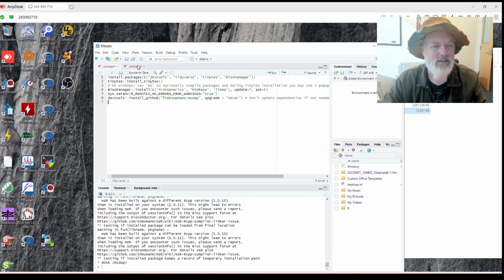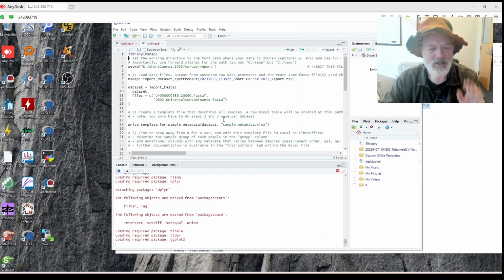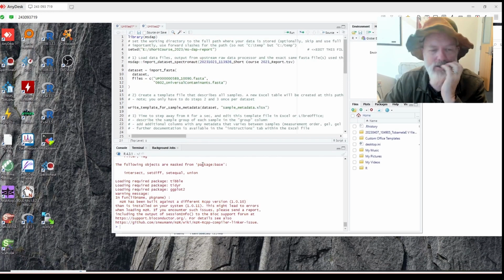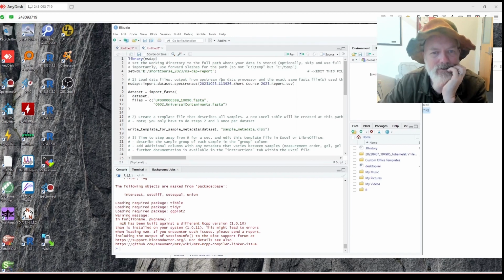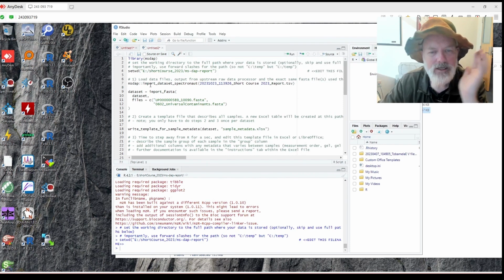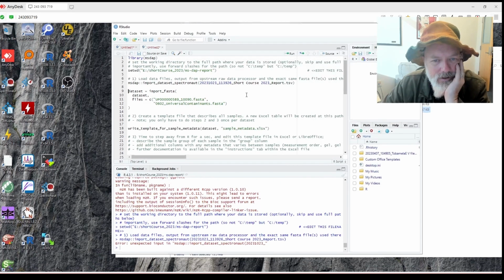Did it all install? Yes, MS DAP. And let's see, we're going to run this line. All right, it worked. Loading. All right. No problem so far. Okay, so good. I think it worked. Awesome. All right, then I'm going to set the working directory to my E drive, and then we're going to load the report, and if we did everything right, this report should work. Error, unexpected input. Okay, I did this right.